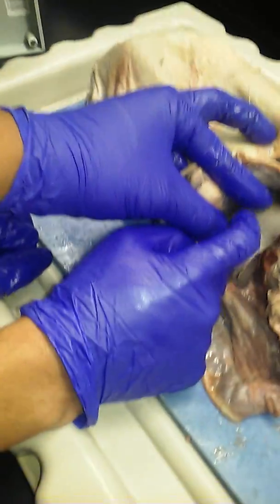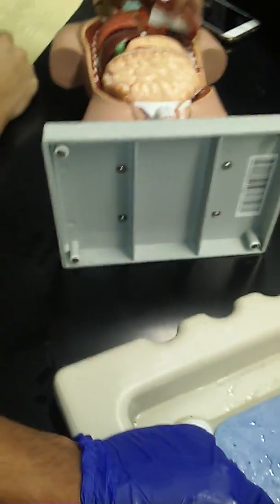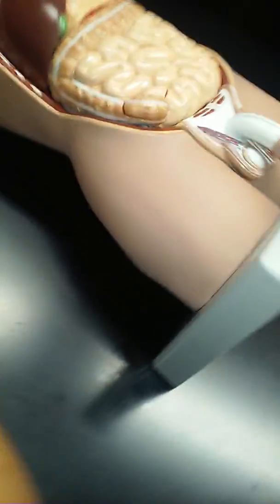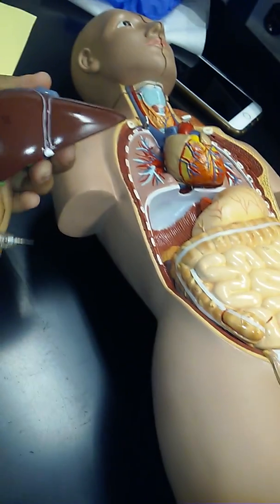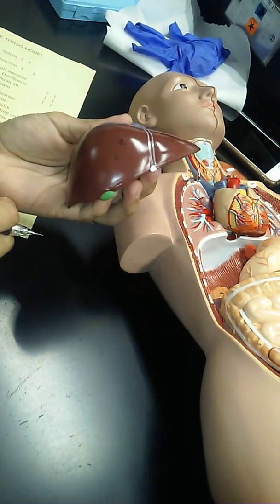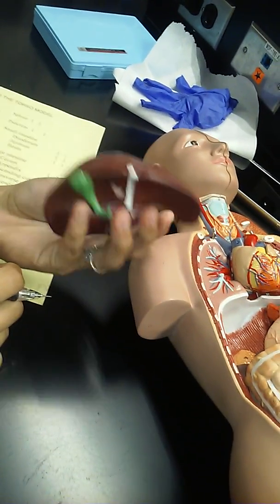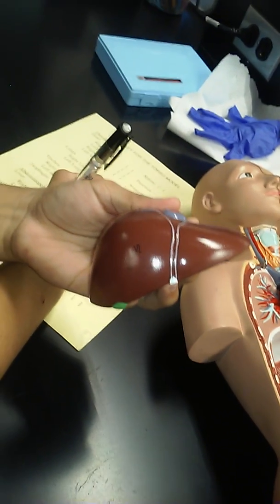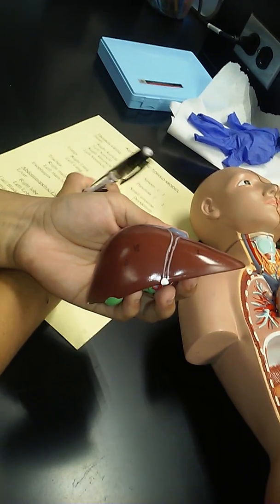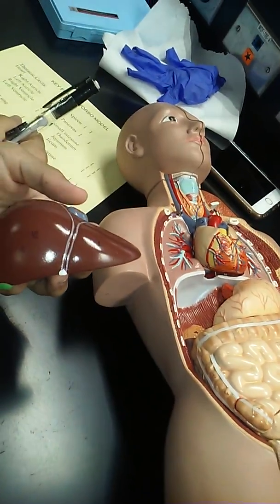Let's compare what we just saw to the human. I'm actually going to take these 2 lung pieces off here. It's just easier to get to the liver if I do. Here is obviously the human liver, right here. Big brown organ. It's in the same exact location in me that it is in the cat. How many lobes do I see right here? 2. All I have to do is go right and left. The human liver actually has 4. There's a couple of small ones in the back, but we're just going to keep this simple. So I've got 2 in the front. So, human liver, cat liver.